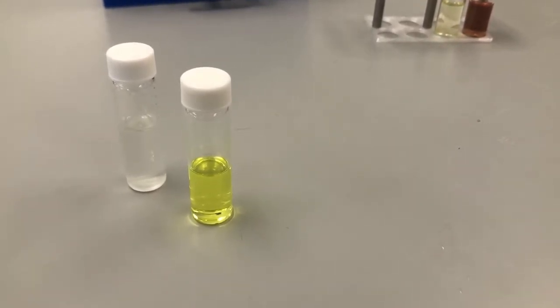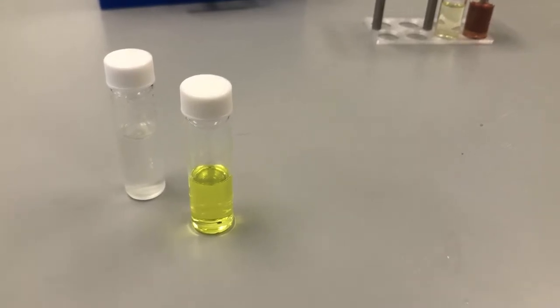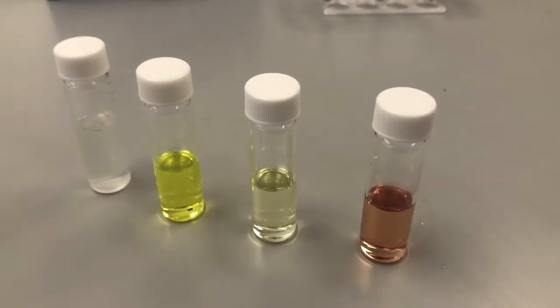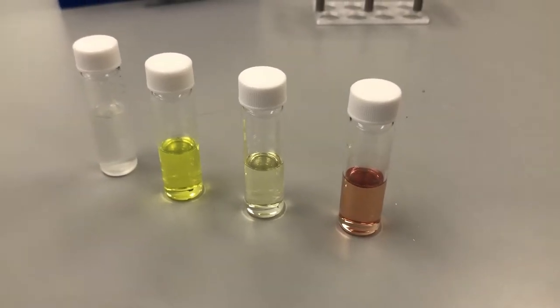We forgot to write it down, but if you're interested, let us know in the comments and we'll figure it out. The third catalyst is going to be our yellow, and the fourth and final catalyst obviously will be our red.